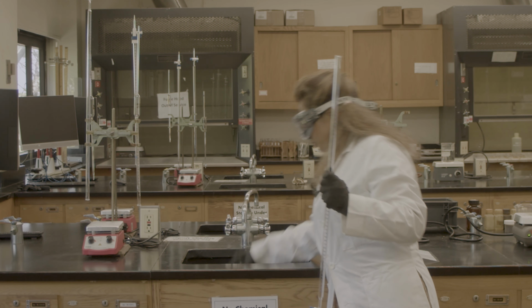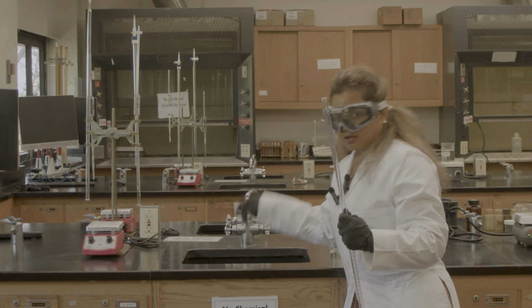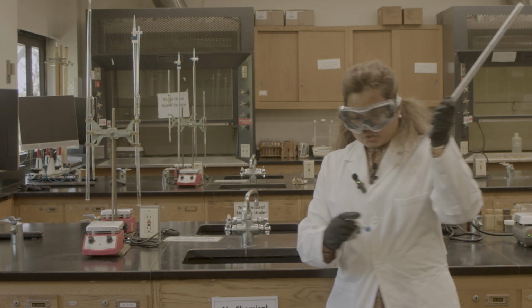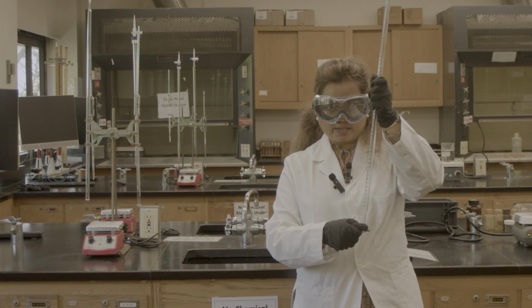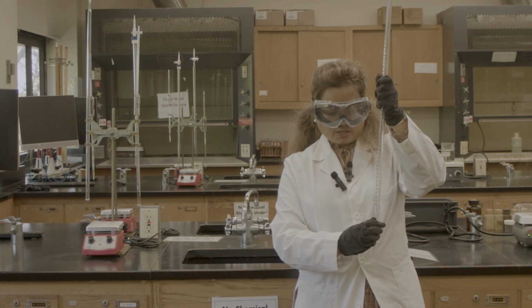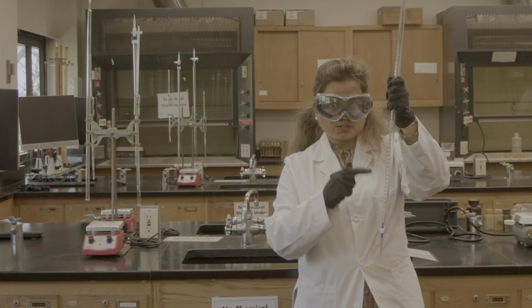Make sure you put a waste container in the sink, because when you read the burette, it should be at eye level. One more thing: this way, the horizontal way, the burette is closed, and this way, the vertical way, it is open. So that means the liquid can transfer.